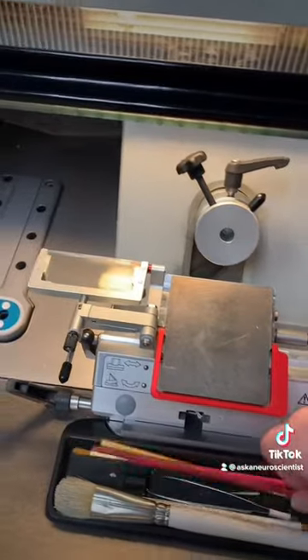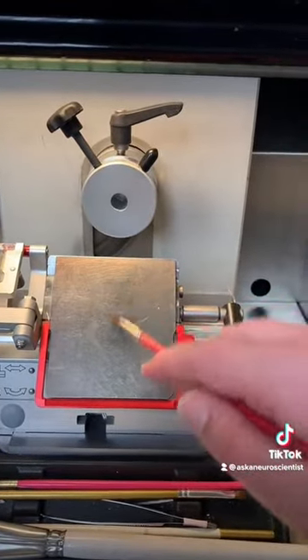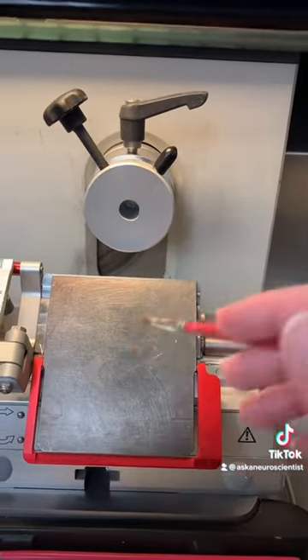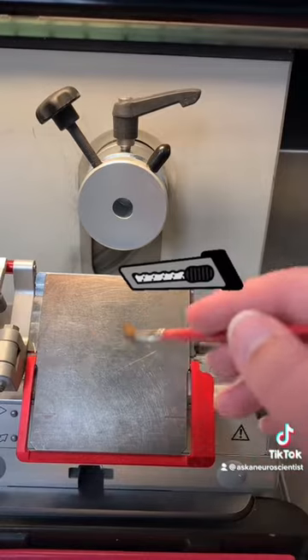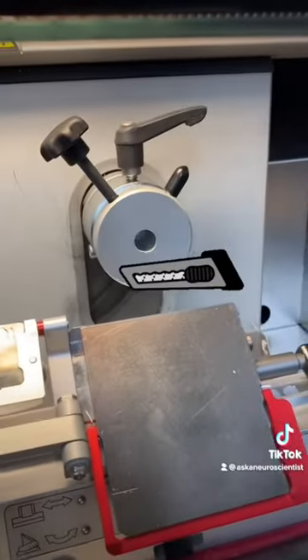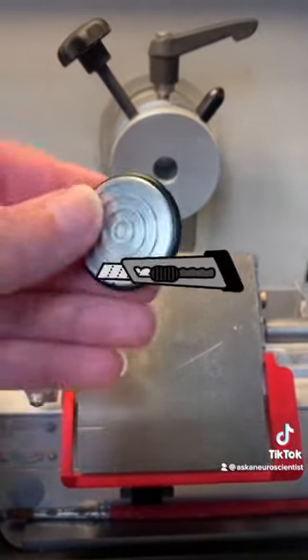I sectioned my brains on this thing — it's called a cryostat. A lot of people in the original video were asking how I got my sections so thin, and it's using this. It moves kind of like a deli slicer but in reverse. That area I was just stroking with the brush is where a blade would normally go — we keep the blades out when it's not in use for safety reasons. That giant circle at the back is actually going to move towards the blade.